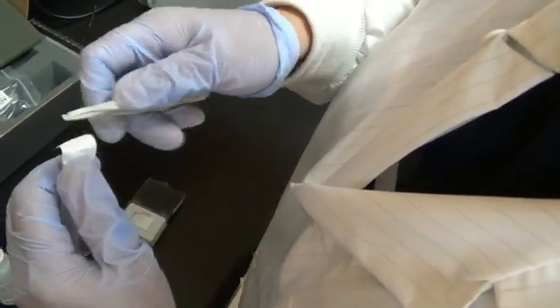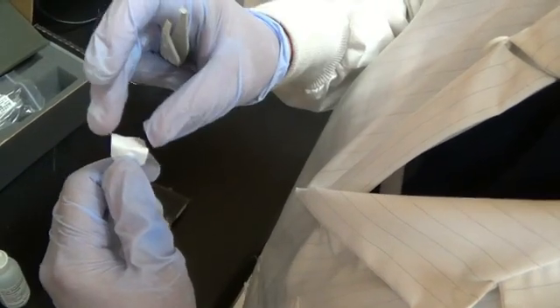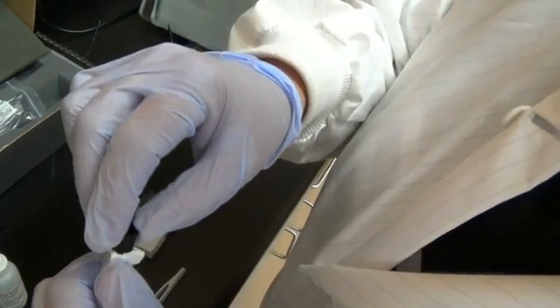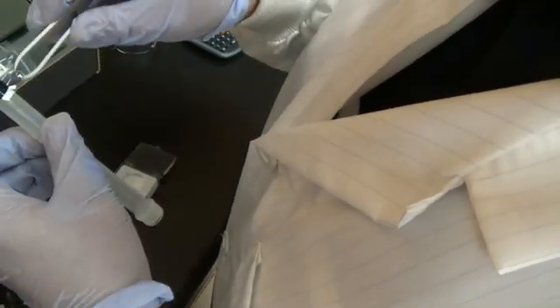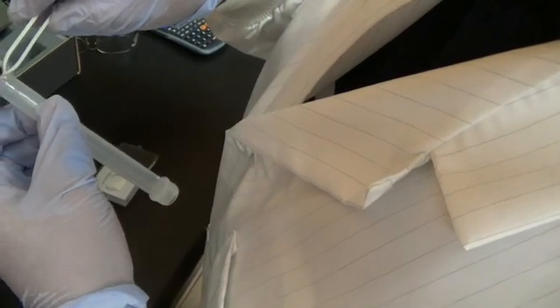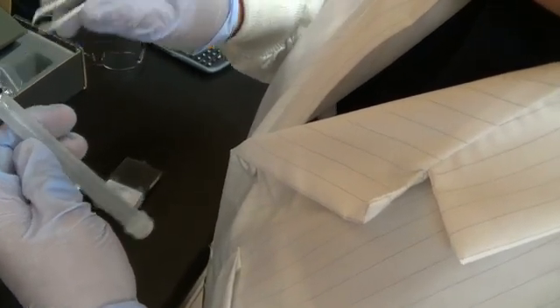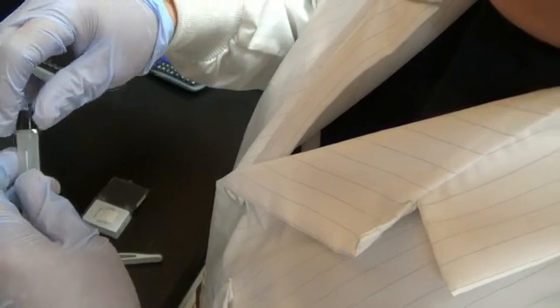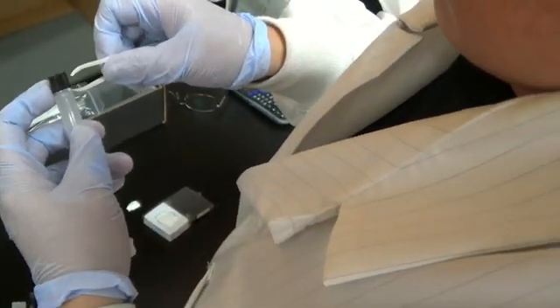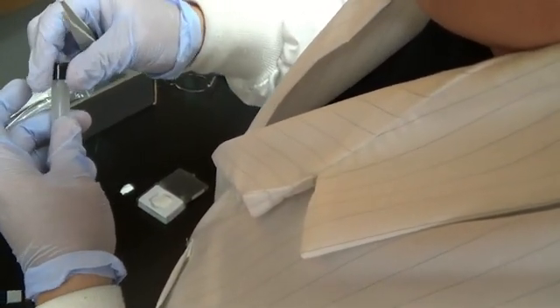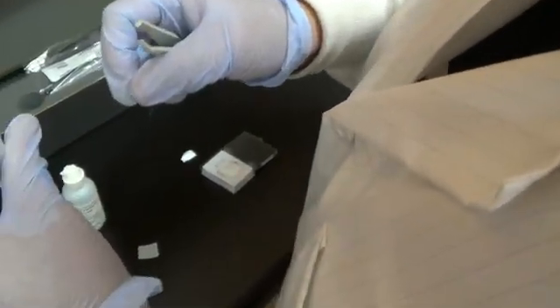Spread it over to the center. Start putting the little cap back on. And then you do not want any of this showing. So it's going to be tucked under the cap. So I usually just spread it sideways a little bit. And there you go.